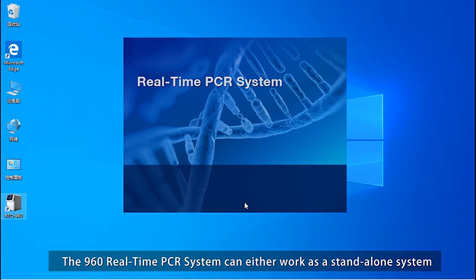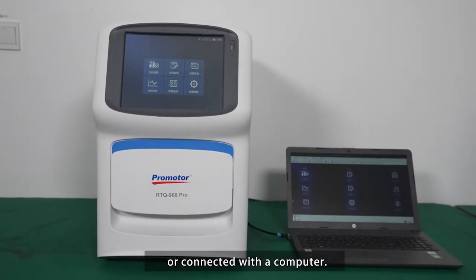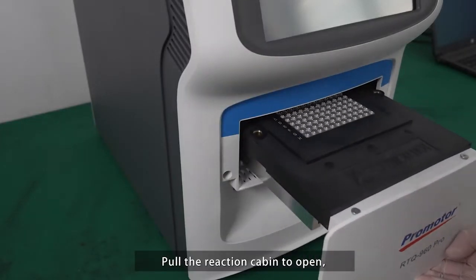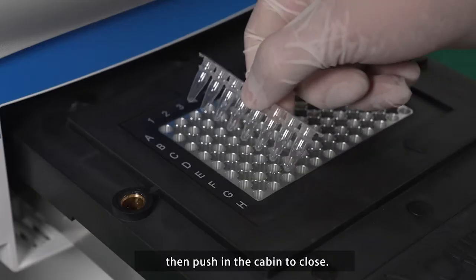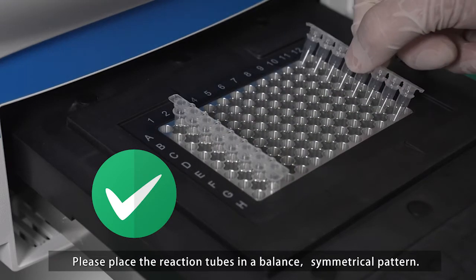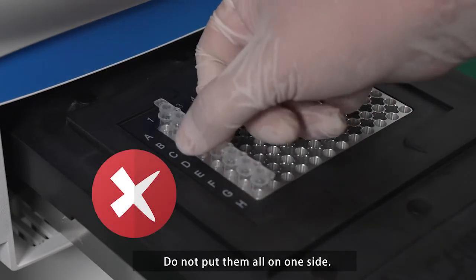The 960 real-time PCR system can either work as a standalone system or connected with a computer. Load PCR reaction tubes. Pull the reaction cabin to open. Place the reaction tubes in the wells inside, then push in the cabin to close. Please place the reaction tubes in a balanced, symmetrical pattern. Do not put them all on one side.